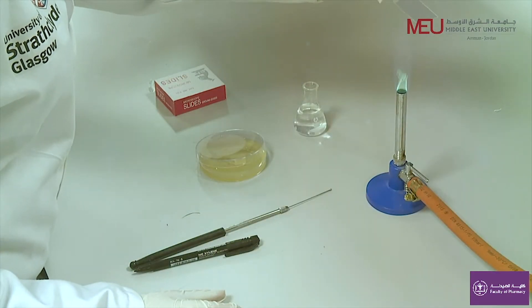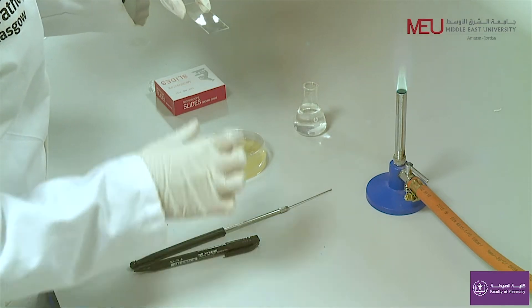After rinsing the glass slide under tap water, move it over the flame to dry and sterilize it.